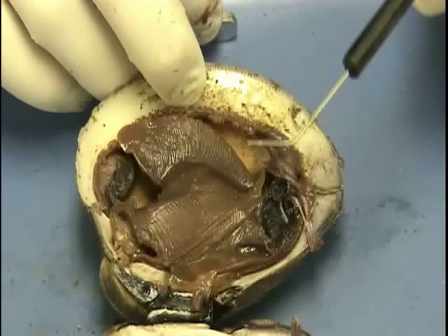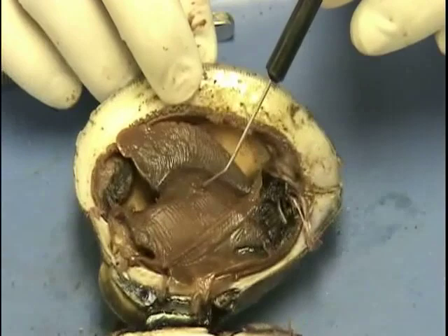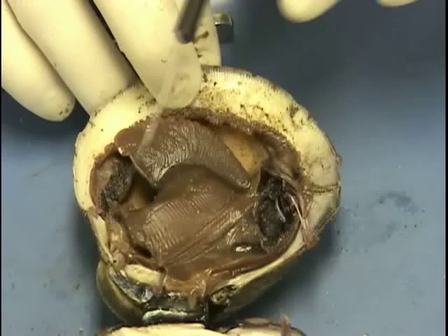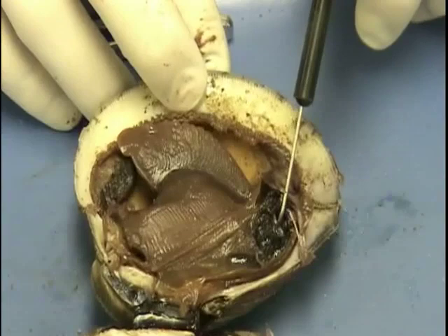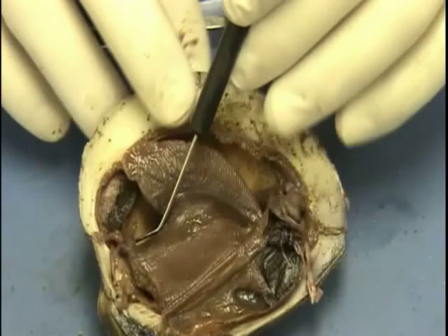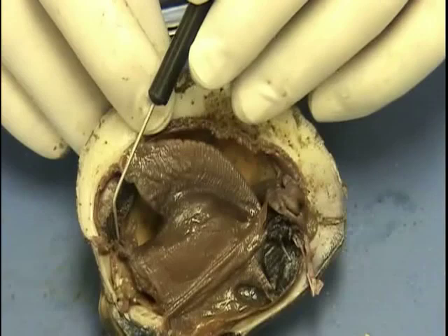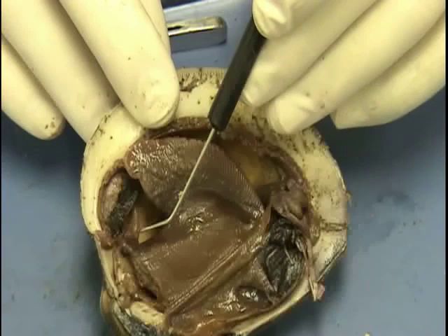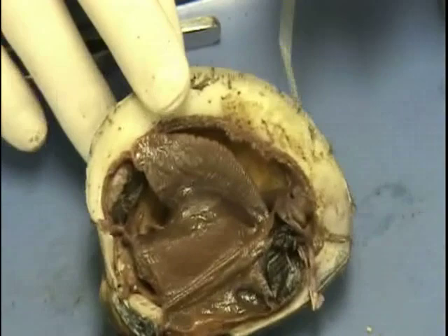The next thing is the anterior muscle. Remember, to find the anterior side we look for the umbo — there's the umbo right there. So the anterior muscle must be right here — this whole section right here is the anterior muscle. The posterior muscle is the opposite side. The next thing are the palps. Here are the palps — this is a bilaterally symmetrical organism, so here are palps on this side, and on the opposite side there are more palps right here. The palps lead to the mouth; the mouth is kind of hard to see. The palps help guide the mucus loaded with food to the mouth.